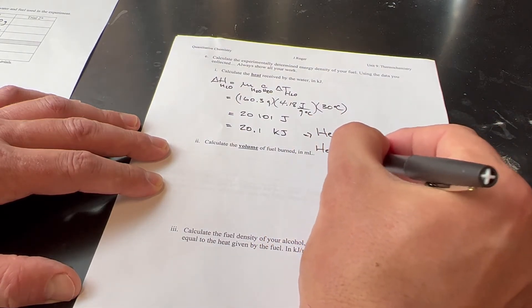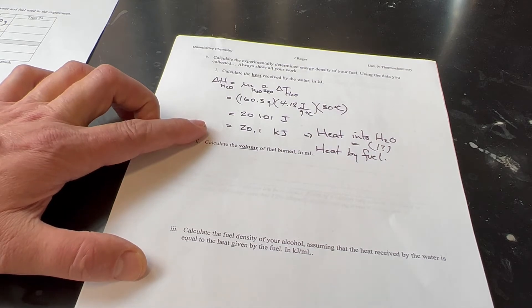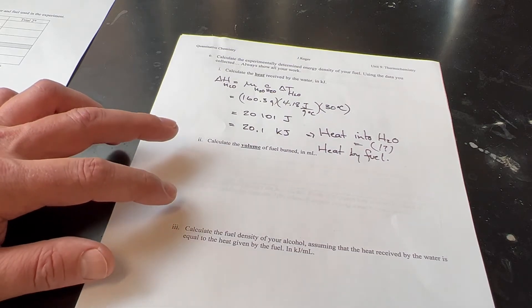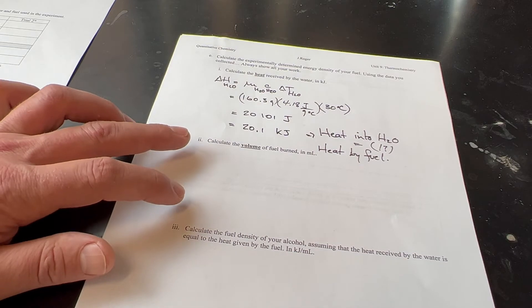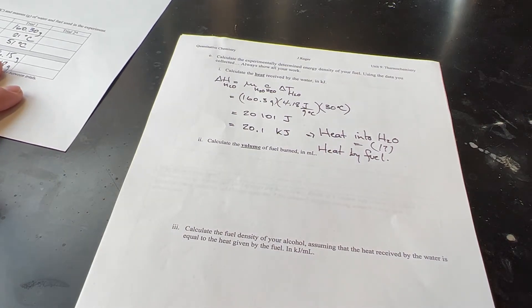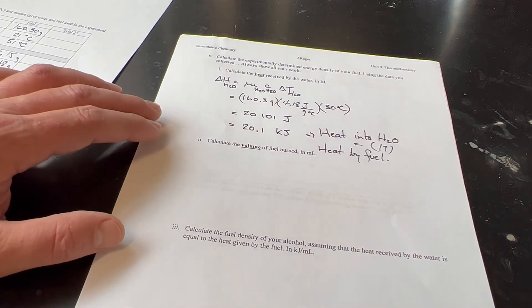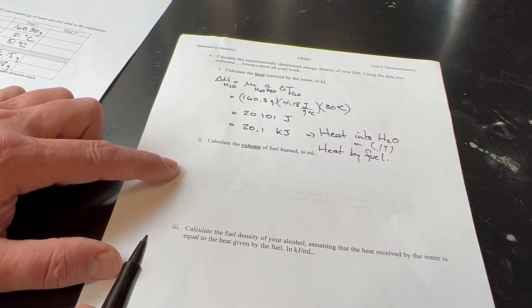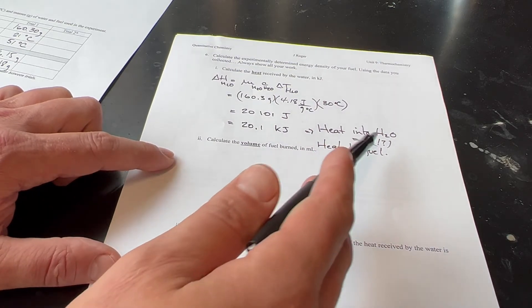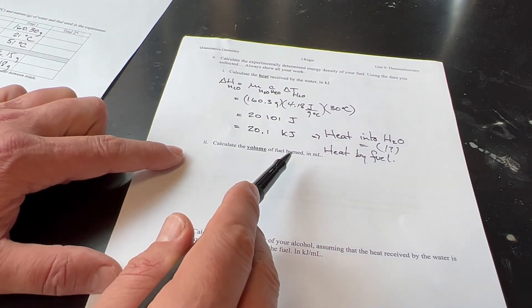We're assuming that the heat received by the water equals the heat released by the fuel, which is not strictly accurate. However, since the purpose of the lab is to compare the energy density of all four alcohol fuels, we're making the same assumption for each one, so the comparison is still valid. The error is incorporated equally into all fuel calculations.